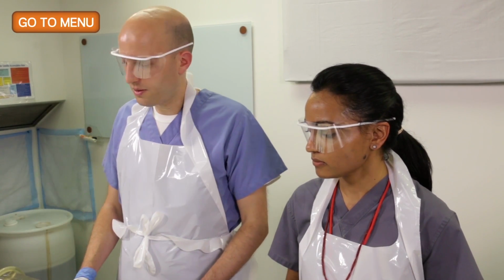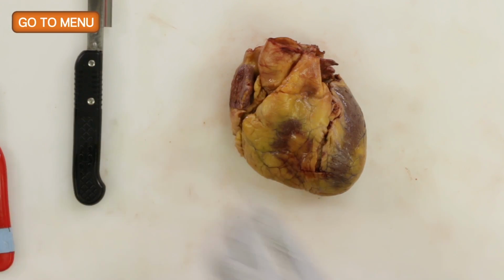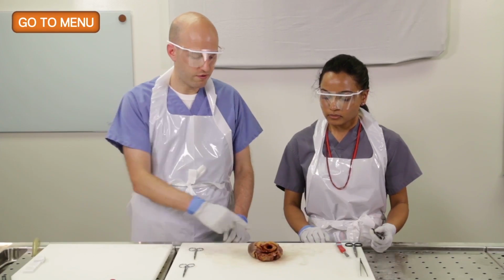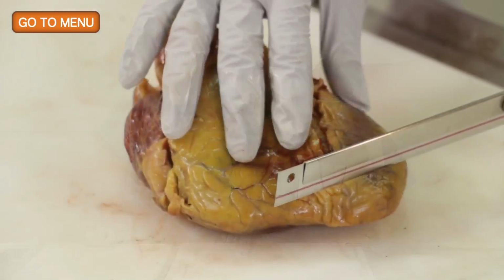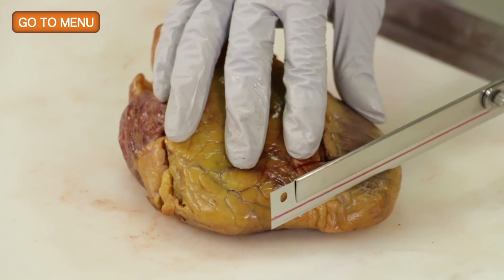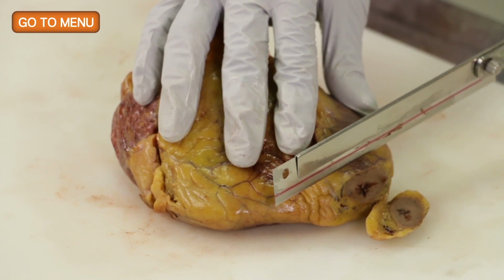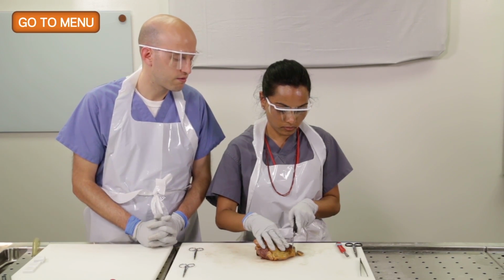Okay, so why don't we take our larger knife. Here, I'll let you do this. And so you can hold it in any way you want. So we're going to bread loaf the apex for a few slices through here. Yep, that's good. So you want to make them relatively thin.